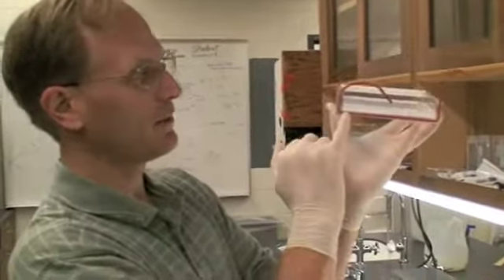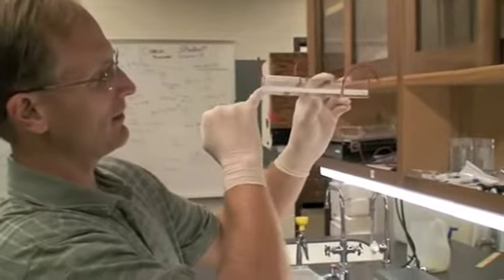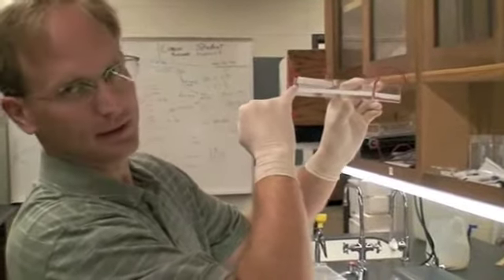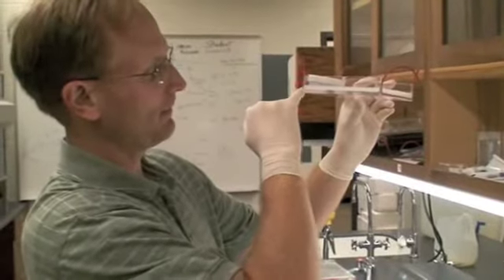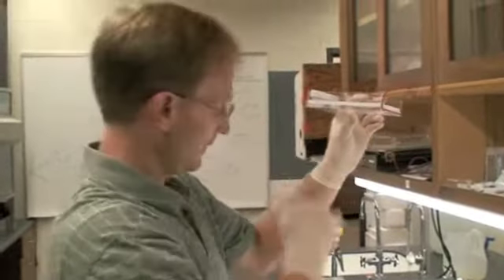So that's the gel, and that should be about a 0.6 centimeter height. The key is that there's enough gel going up the teeth that'll leave enough volume for my samples.